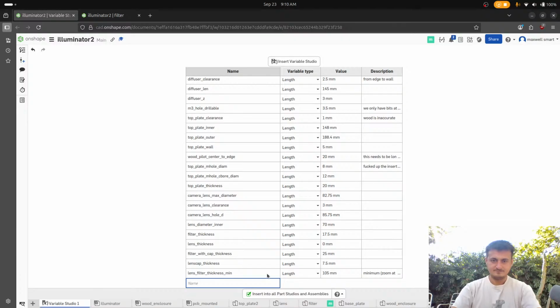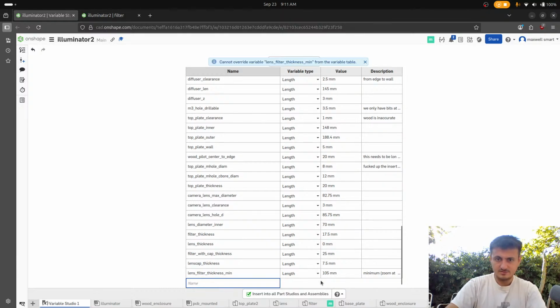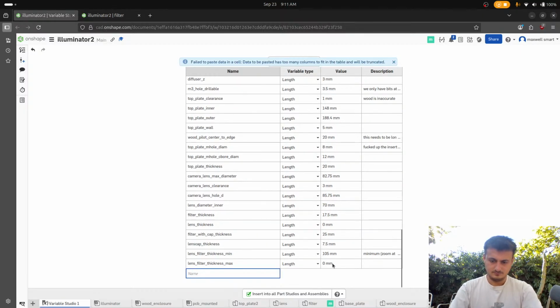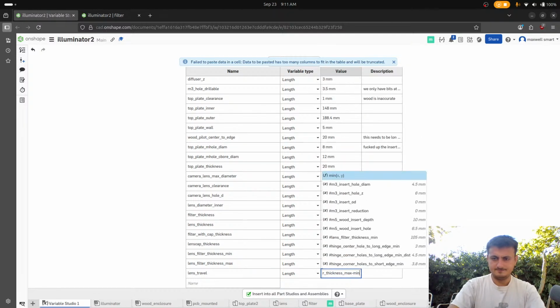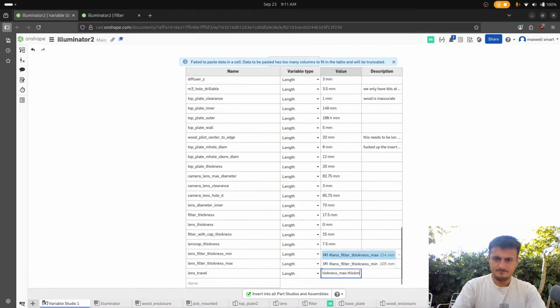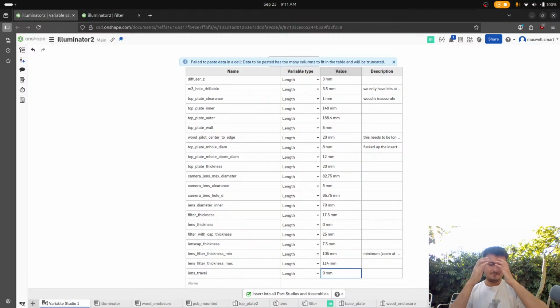113. Bro, does that really not copy? That's so stupid. Oh my gosh. Just say 114. Okay, so that means that the lens travel, okay. We also could have done it like this. Yeah, it's like 9.